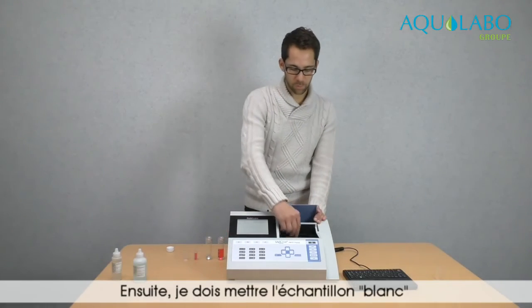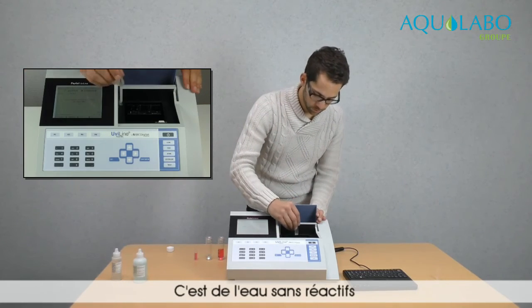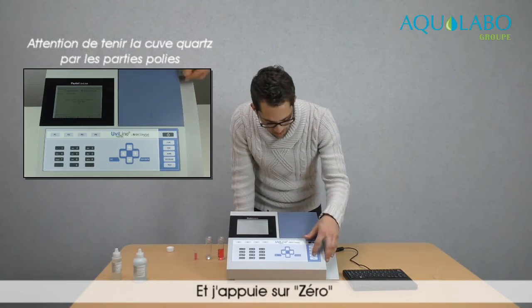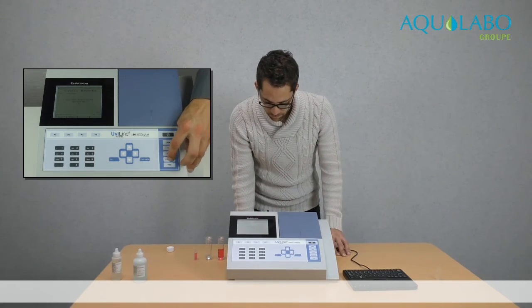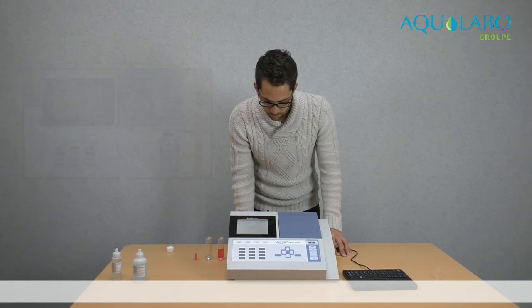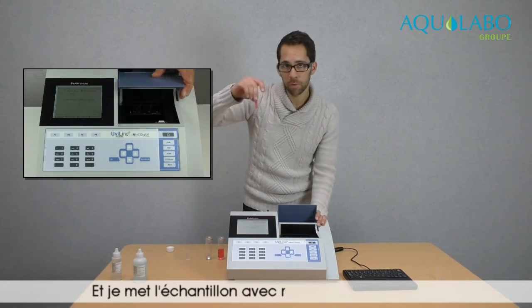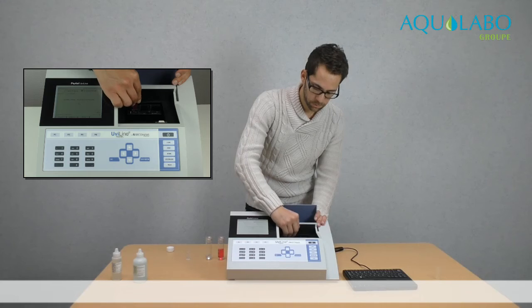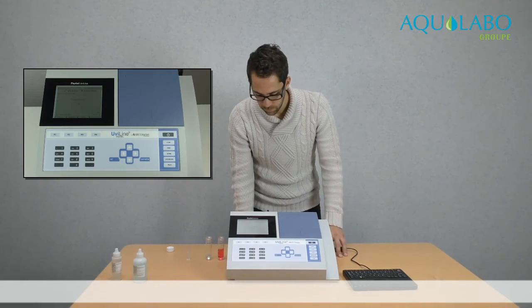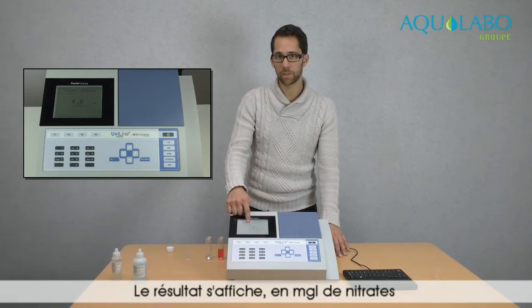Now I have to put a blank sample, so it's a water without reagent. And then I press 0. I remove the cell, and then I put the sample with reagents. And I press Start. And here is the result in milligrams per liter of nitrates.